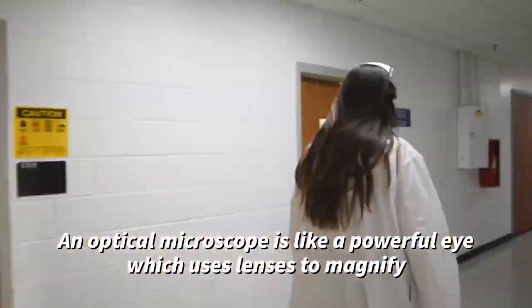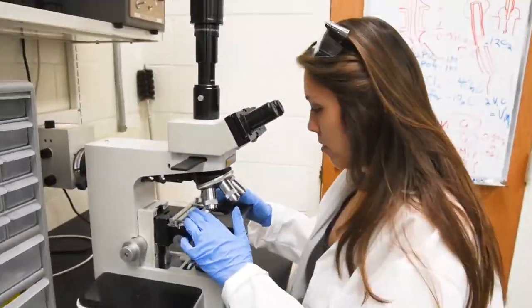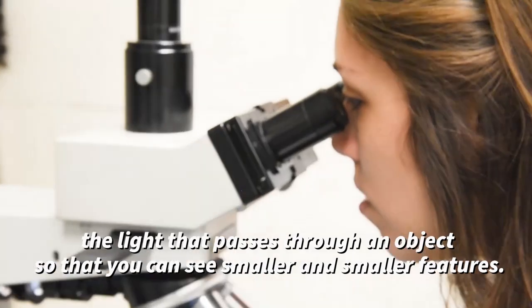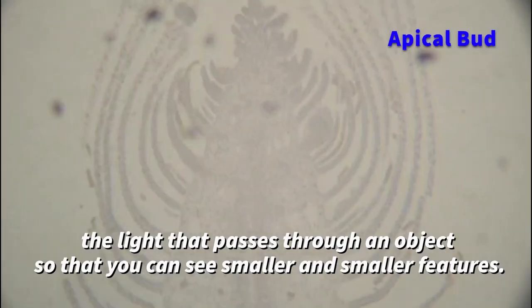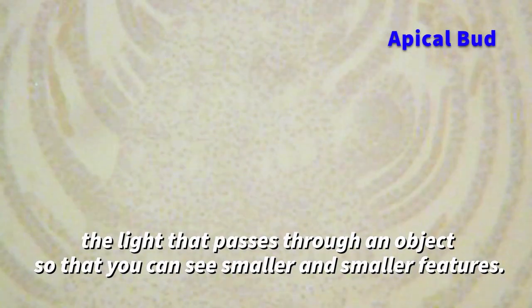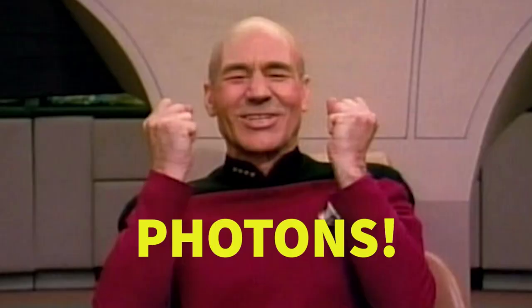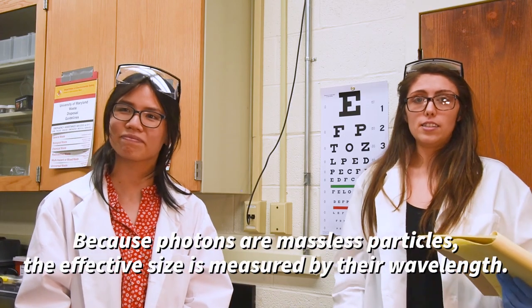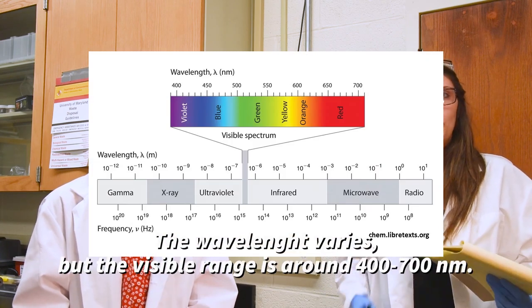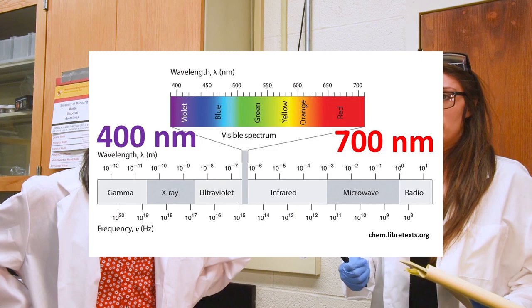An optical microscope is like a powerful eye, which uses lenses to magnify the light that passes through an object so that you can see smaller and smaller features. Light is made up of photons. Because photons are massless particles, the effective size is measured by their wavelength. The wavelength varies, but the visible range is around 400 to 700 nanometers.